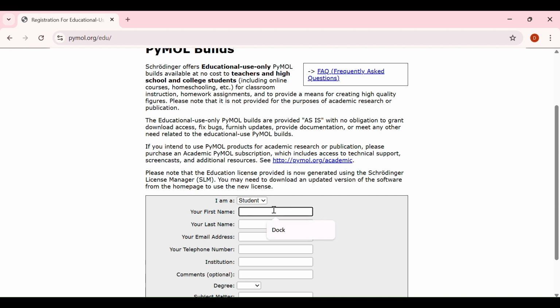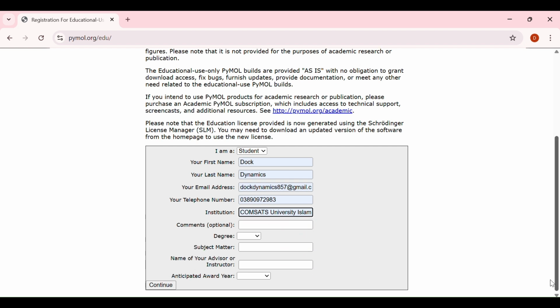Then write other information like first and second name, your email address. By the way, you have to write your institutional email, your telephone number, your institution. If you have any comments, you can add, otherwise, that's optional. Your degree and the subject. Moreover, you have to add the name of your advisor or instructor and the anticipated year. Then click on the continue button.